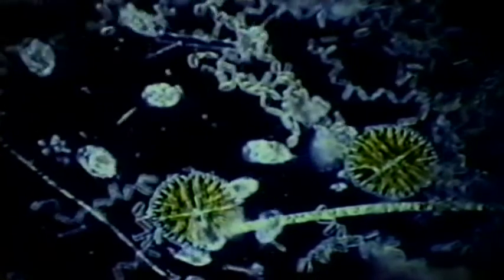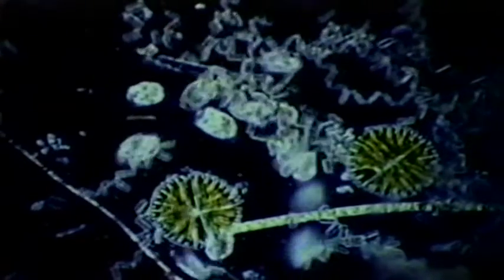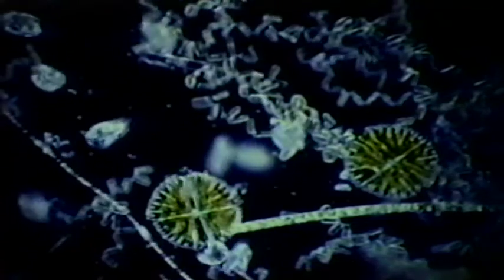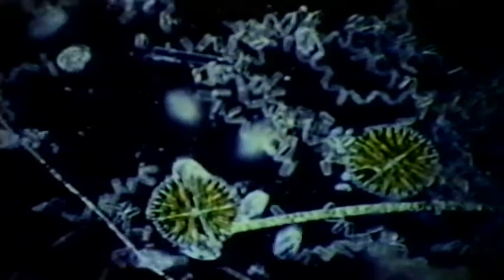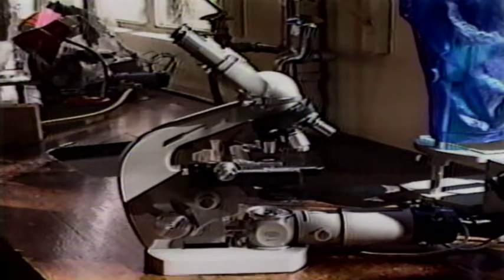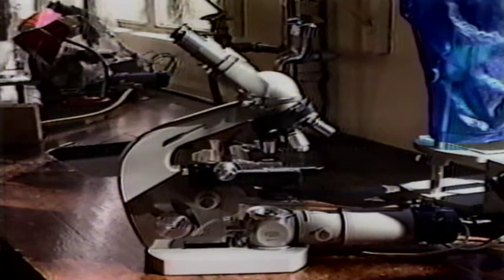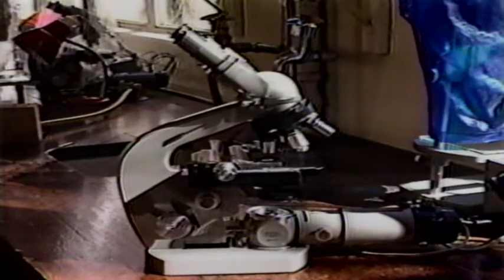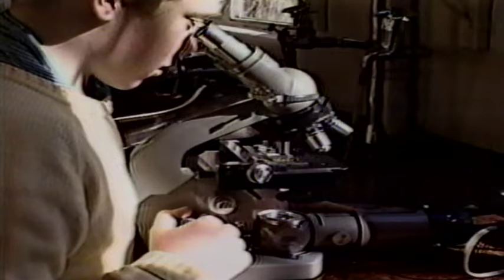Ever since its invention in the 17th century, the microscope has allowed its users to glimpse another world. A drop of pond water is found to be teeming with unimagined life forms, and granules of sugar reveal their crystalline beauty. In this program, we will discover a little of the history of the microscope, what its components are, and learn some of the basic principles of how it is used.